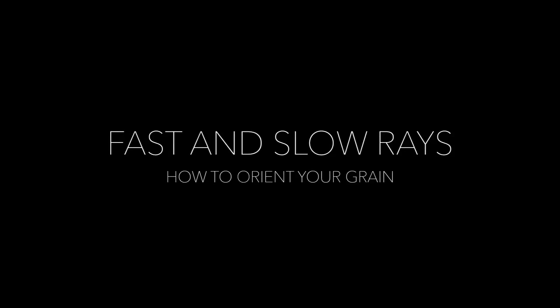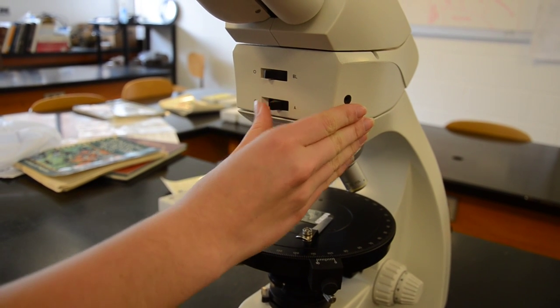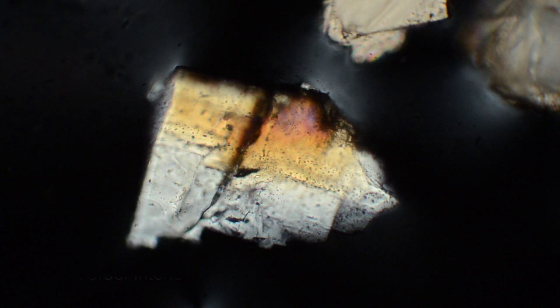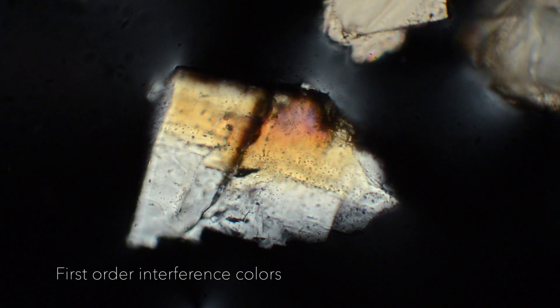In this video, I will go through the steps you would take to orient your grain along the fast and slow rays of a mineral. First, you will need to work in cross-polarized light. Here I insert my analyzer. The grain we see is displaying first-order interference colors in cross-polarized light.